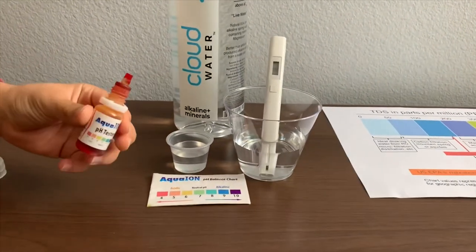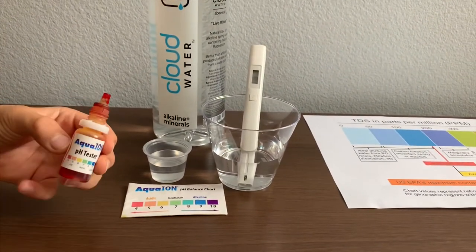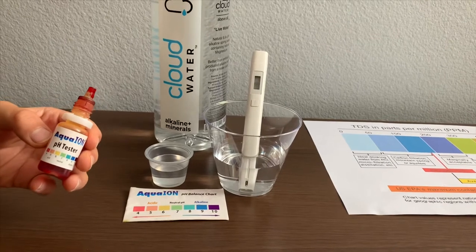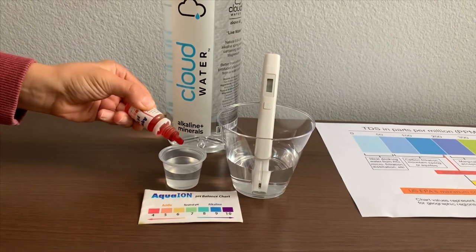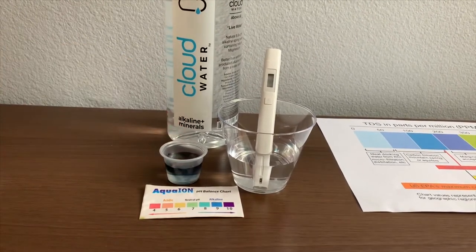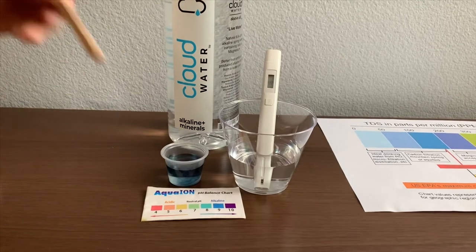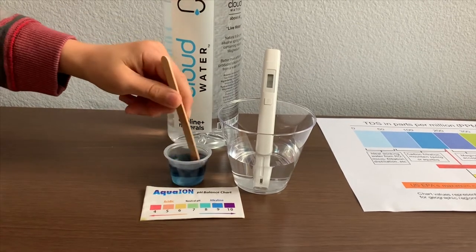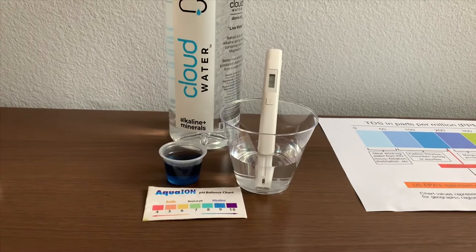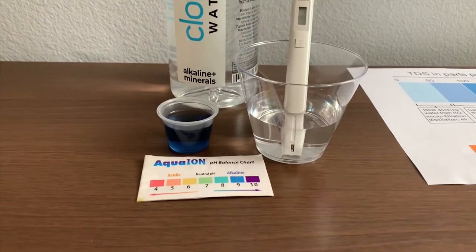Now let's test the pH level. If you want to buy this pH tester, check the link down below. Only do two drops. Let's do a little for a better result. I give this a 9 — this is alkaline water.